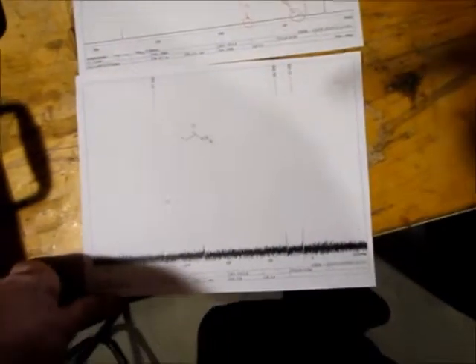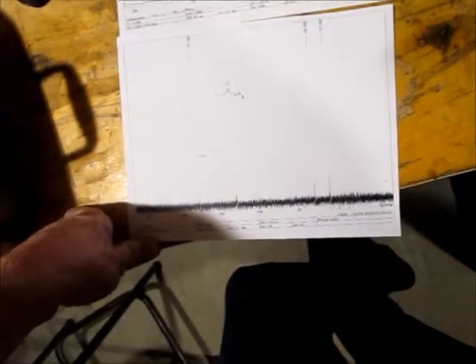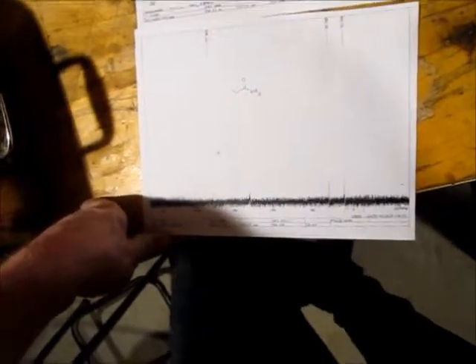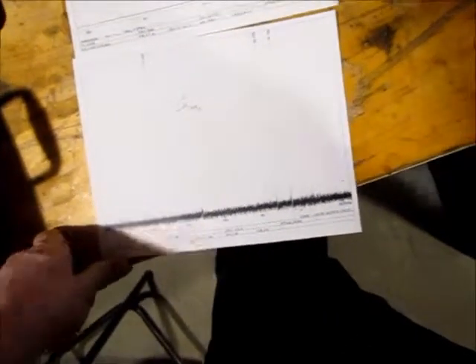So folks, you can basically compare these. I've copied these so you have copies of them. So you can take a look, and then you can basically use the videos for the discussion of both of those reactions, the acid chloride and the amide. And a lot of the observations and results and discussion content is very much similar to the reactions we're doing with the newer compound.